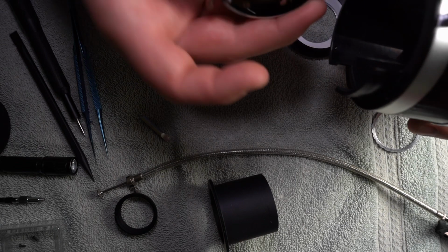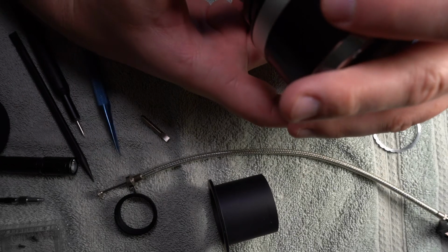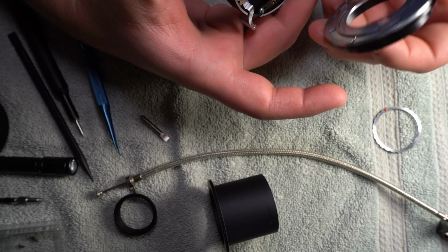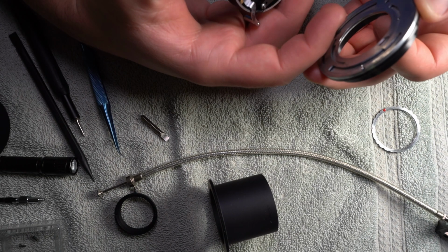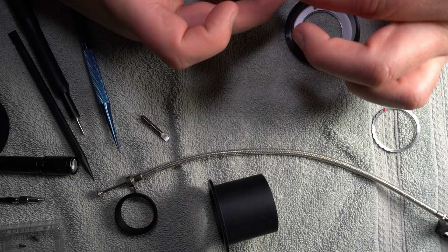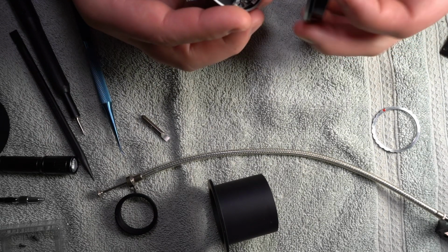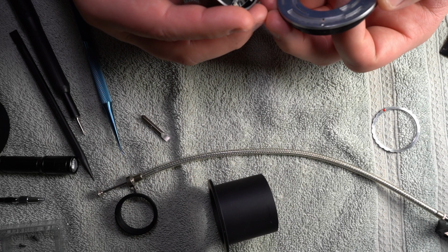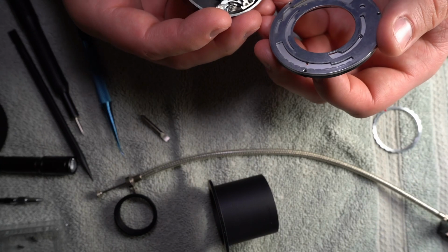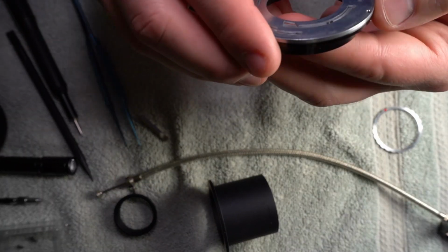Doggone, I forget how this goes. Go that, yeah, it's got to go that way. So that's all the way that direction. Then that would mean that this has to be... good night. And this pin moves. And there's no other alignment, is there? Oh, there is. Wish I hadn't moved that.